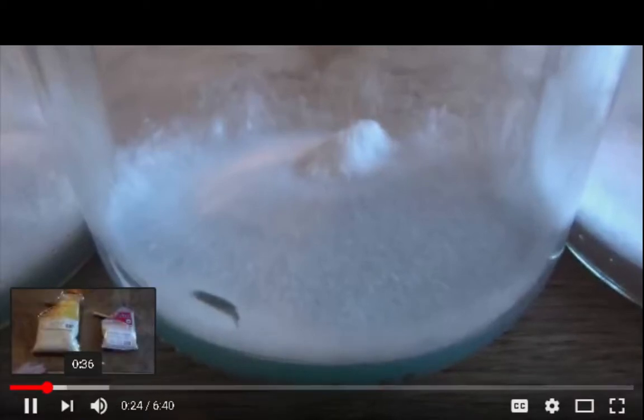Hey guys, today I'm going to show you how to clone a mushroom on agar. This involves taking a small sterile sample of mushroom tissue, of a type of mushroom that you'd like, and placing it onto agar. This allows it to grow out and allows you to isolate a clean strain of a desirable type of mushroom. The mushroom I'll be using is blue-grey oyster mushrooms because I find they grow very well in our climate.